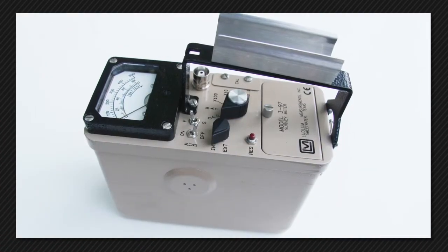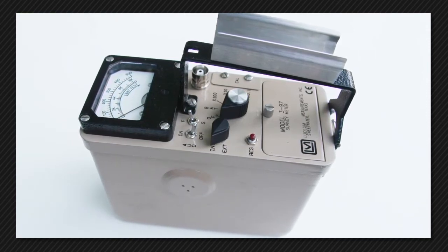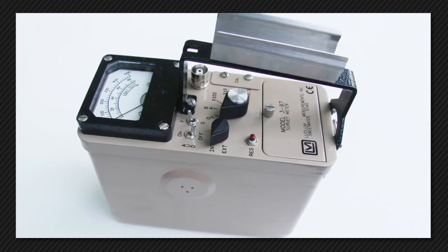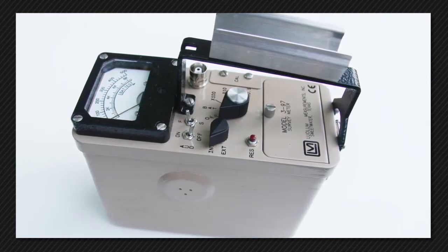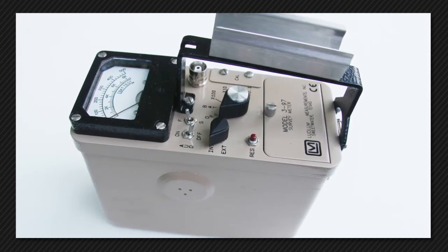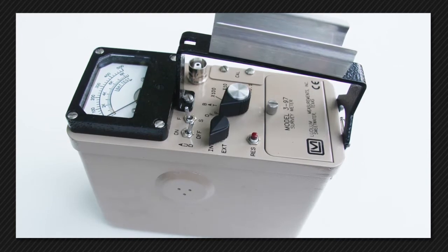Welcome to this naturally occurring radioactive material, or NORM, course, which is intended for workers who may be required to conduct NORM surveys and, consequently, may be exposed to NORM. This course provides a basic introduction to NORM and the use of the Ludlum 397 Radiation Survey Meter for NORM detection.